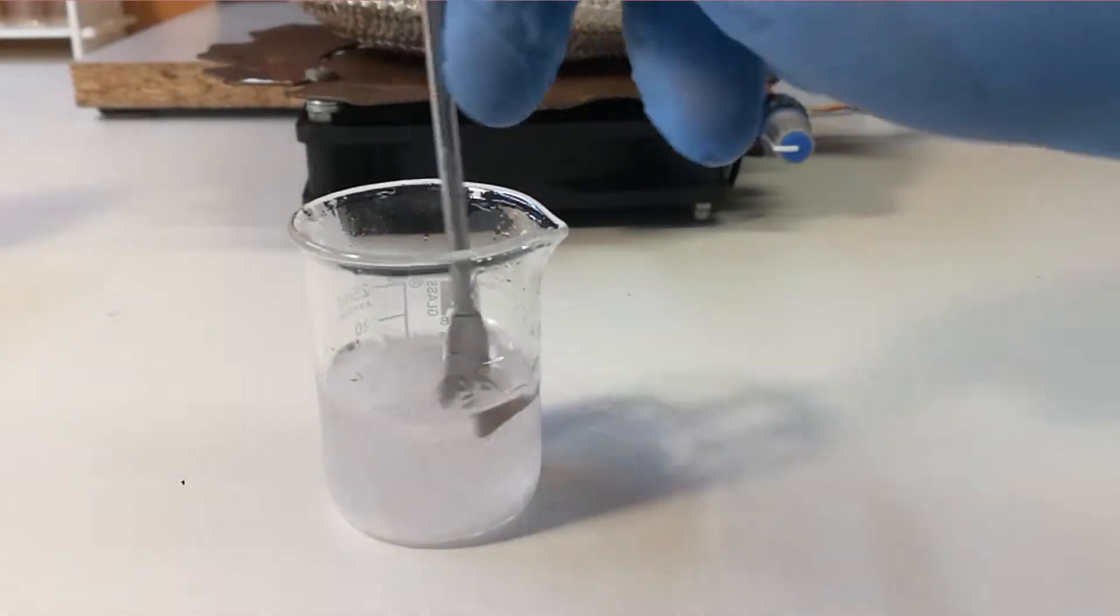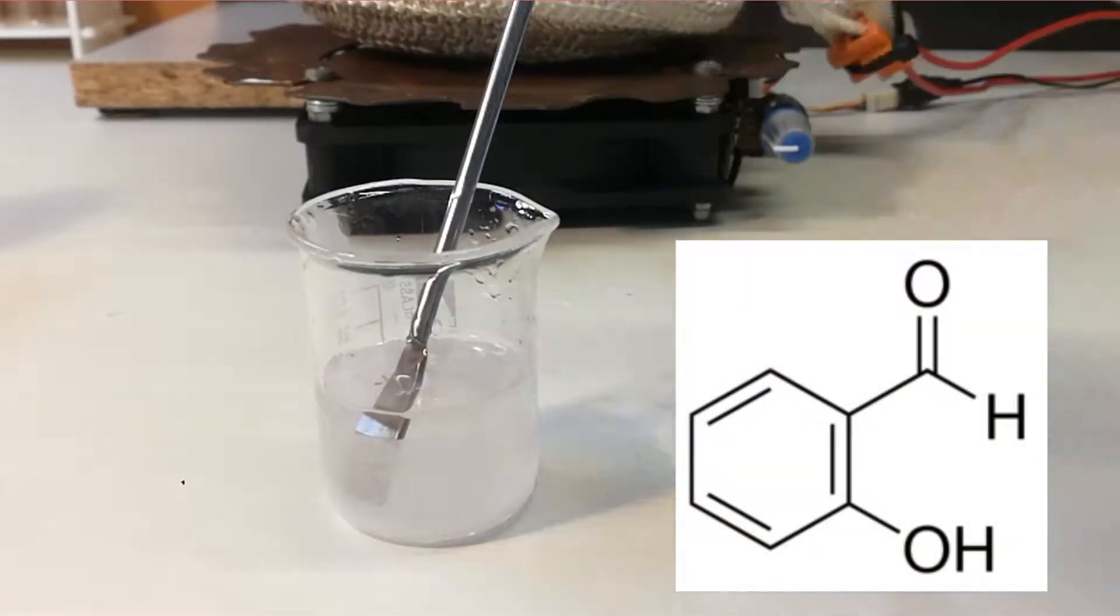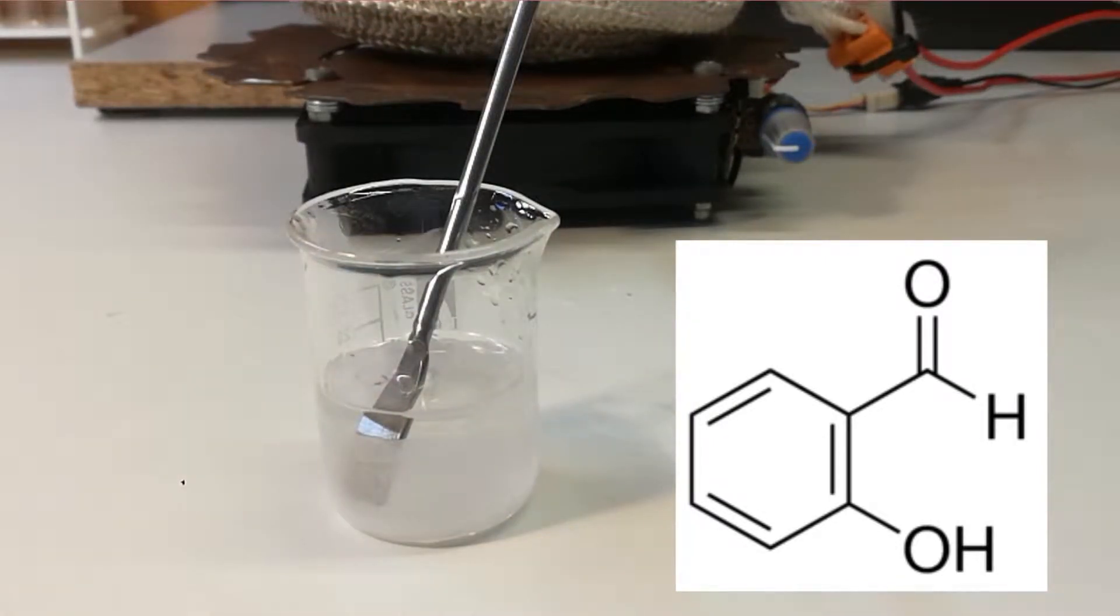Hi, in this video I'm going to make 2-hydroxybenzaldehyde by Reimer-Tiemann Reaction.